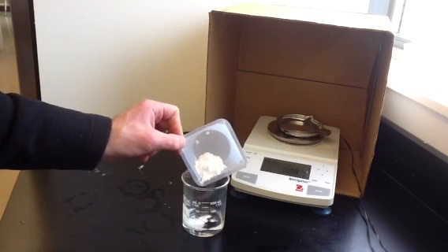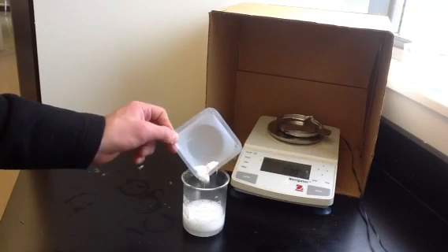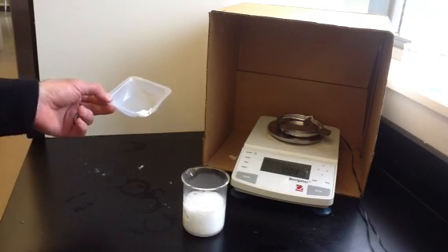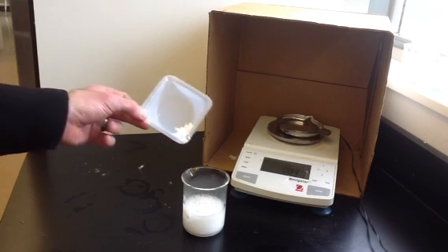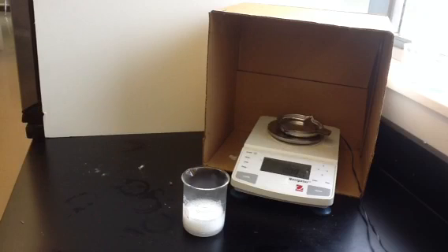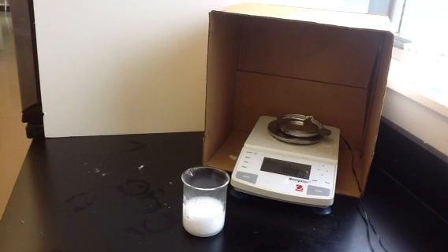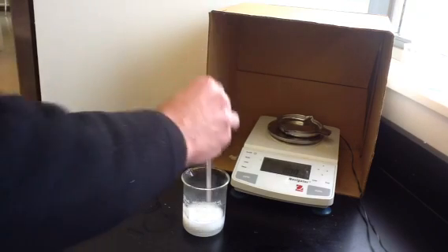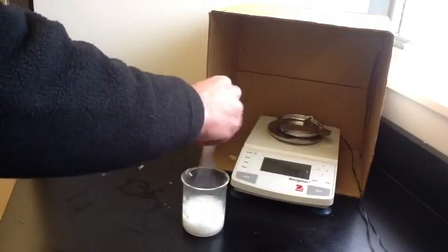Now we're going to add this slowly — we don't want to add it too fast because we don't want it to overflow the container. We'll add it, let it react, add a bit more, and let that react. You can see quite a bit of fizzing taking place, and that's releasing carbon dioxide. The products left in this container won't be as heavy as what we started out with. We'll stir this a little bit to get rid of some of those bubbles and let it finish reacting.